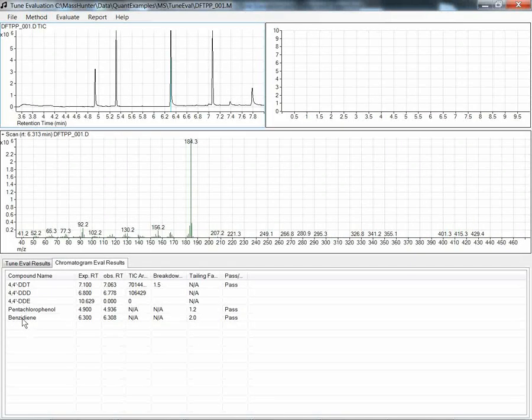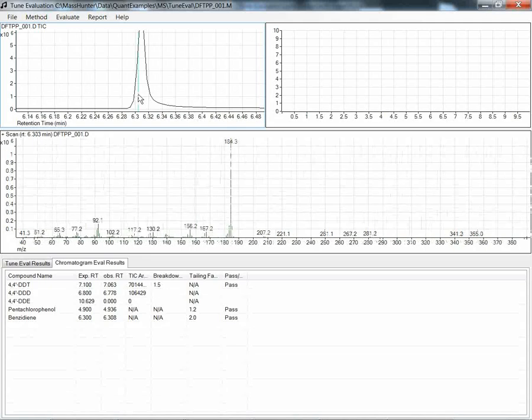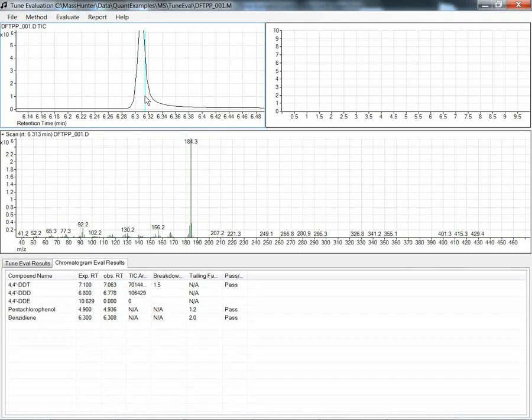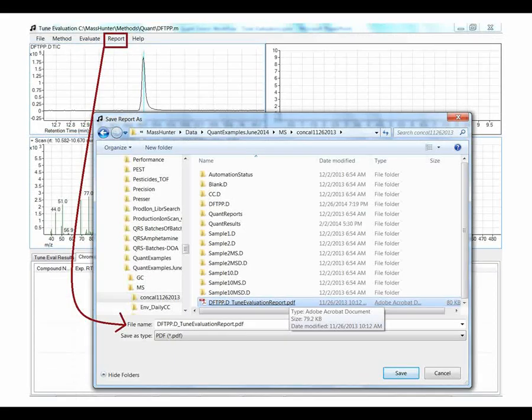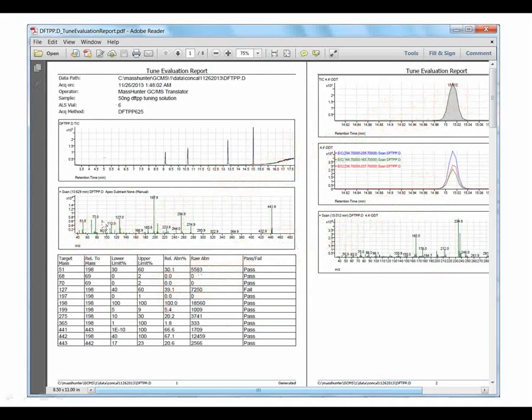Let's do a quick visual confirmation of benzidine here at 6.3. If I go to 6.3 and look at that part of the chromatogram, I can see there is some tailing, and I can look across the peak and check out 184, which is my target ion for benzidine. And last, I can capture that information in a report from the report menu. I can generate a PDF file, and that will turn into a nice capturing of what you see on the screen with the criteria and the results, as well as the details of the chromatographic evaluation.